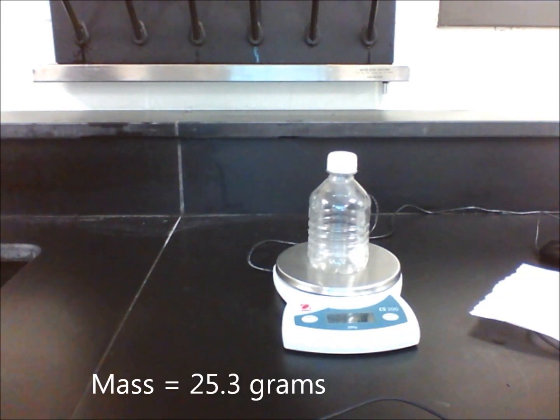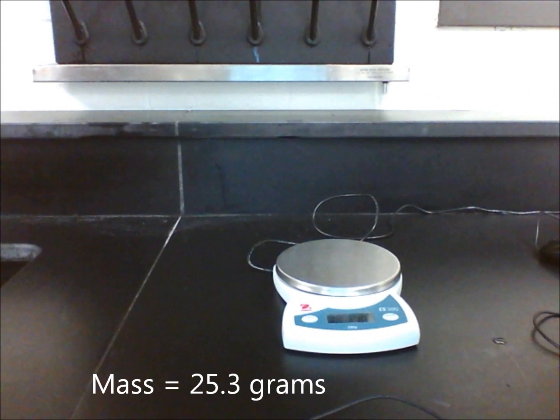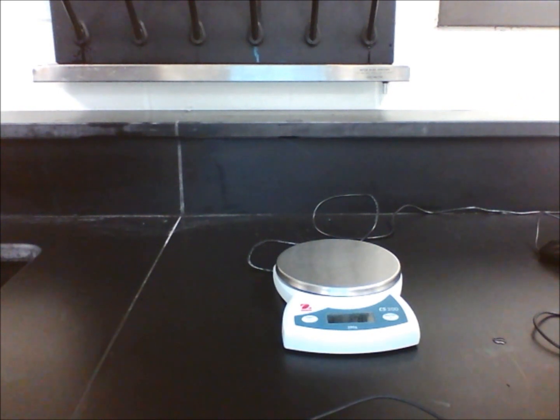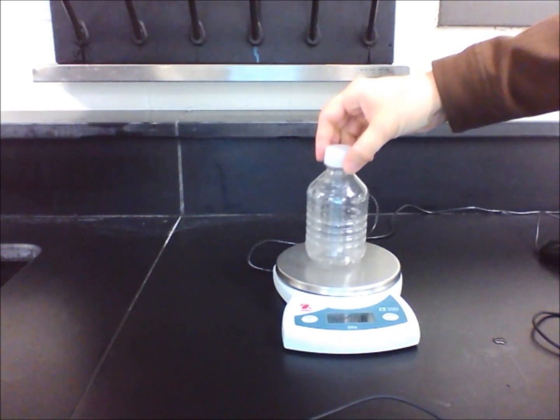Then wait for the ice to melt completely. After the ice has changed into water, wipe off any condensation from the outside of the bottle with a paper towel before weighing the plastic bottle again. Record the new mass.